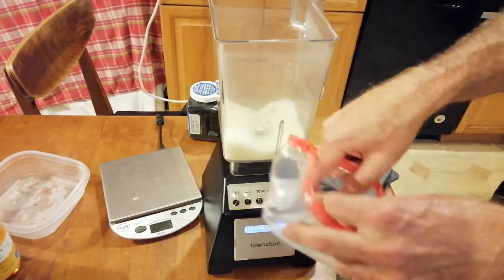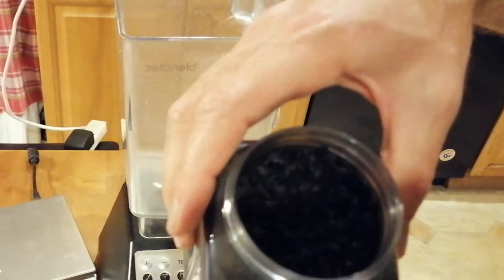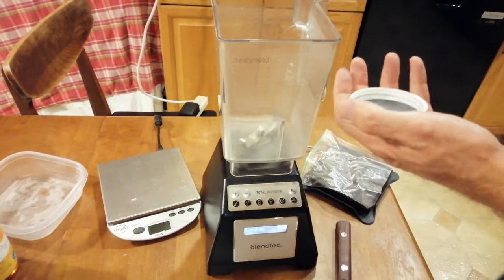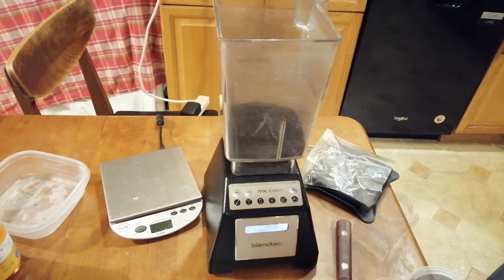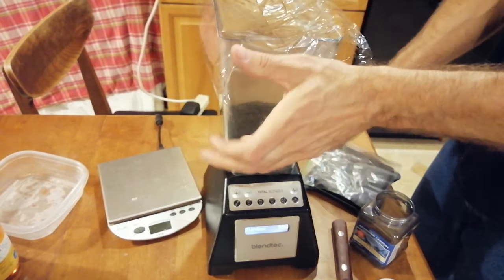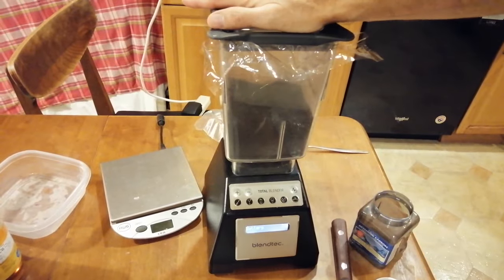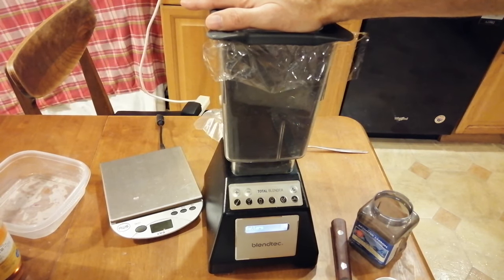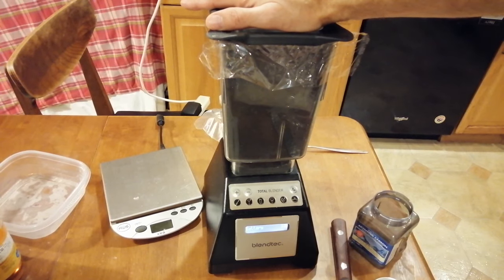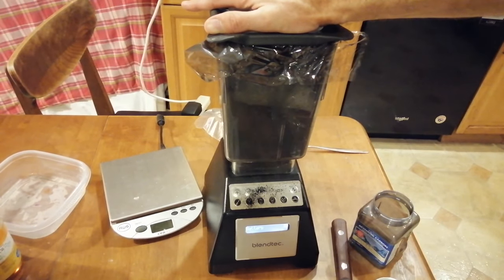We'll pour the agar powder into a labeled ziploc bag. If you're going to make black agar — which I don't actually recommend — you can blend down some activated carbon. You can find it in pet supply stores with the aquarium supplies. It's usually in pellets but we need it in powder form. I put some plastic wrap over the top because this is going to make a fine dust cloud. Something interesting happened while blending this down — it actually explodes, sending some of the powder shooting out of the blender. One more reason not to make black agar, but this didn't cause any real problems.